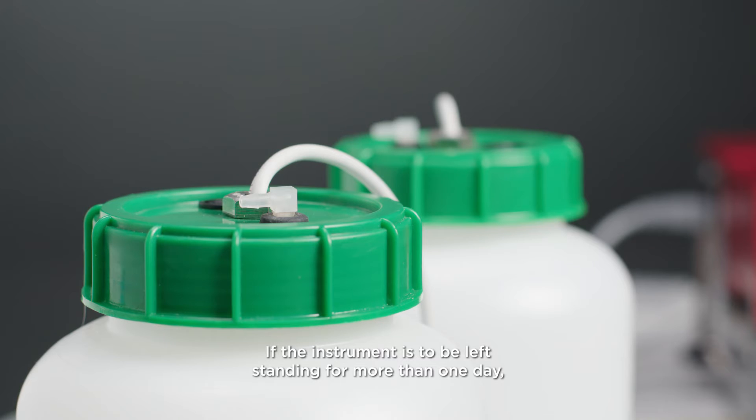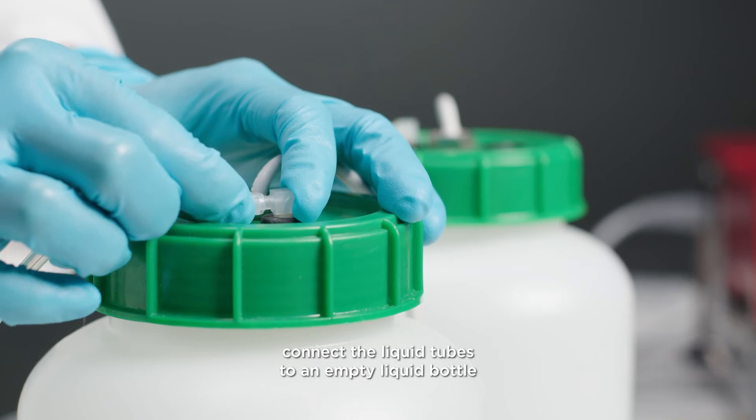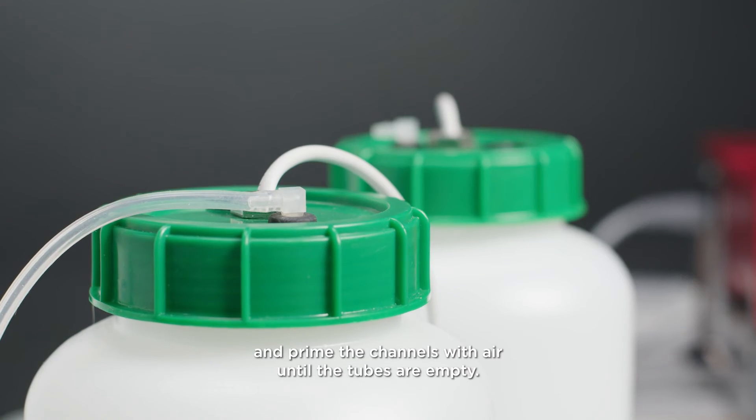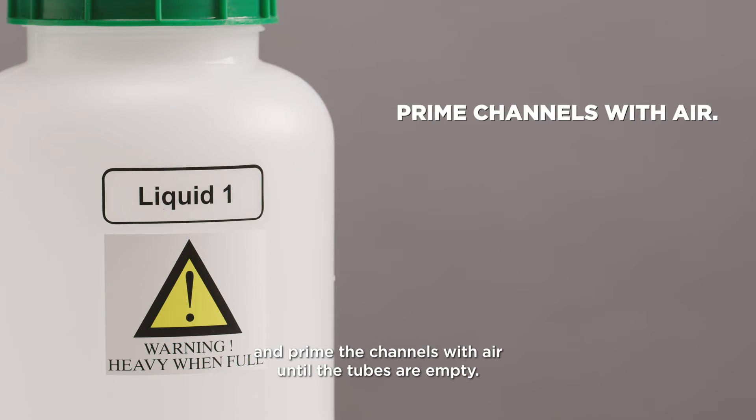If the instrument is to be left standing for more than one day, connect the liquid tubes to an empty liquid bottle and prime the channels with air until the tubes are empty.